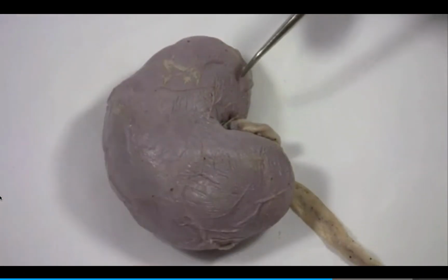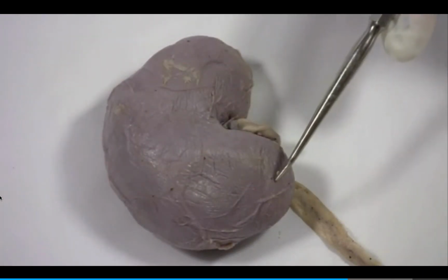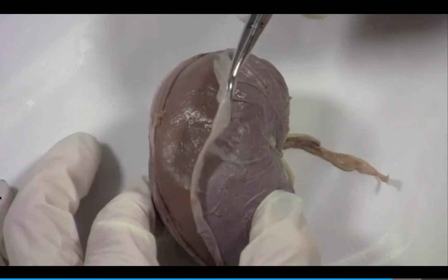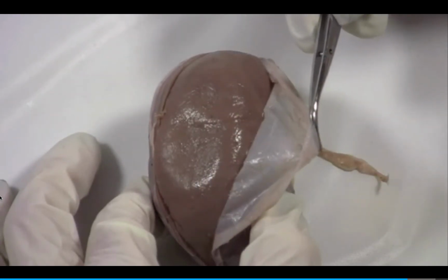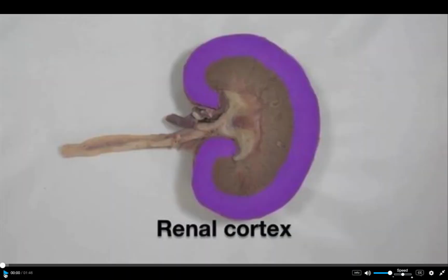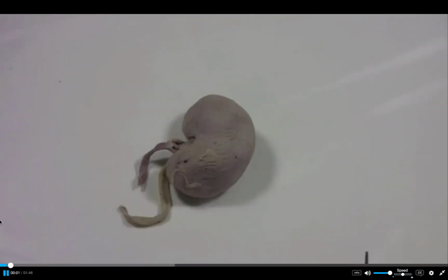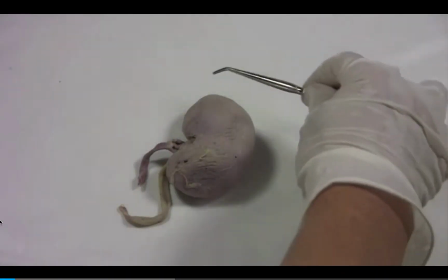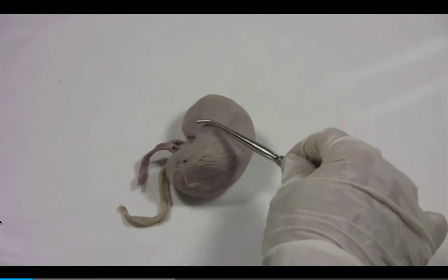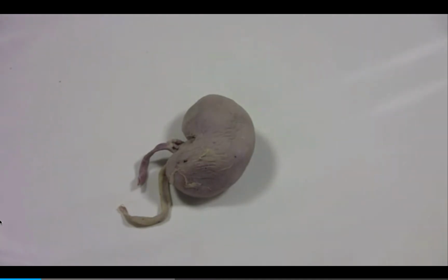The entire kidney is encased by dense fibrous connective tissue called the fibrous capsule. Here you can better see the fibrous capsule. To make a frontal section, what we want to do is make an incision down the longitudinal axis of the kidney to divide it into an anterior and posterior half.